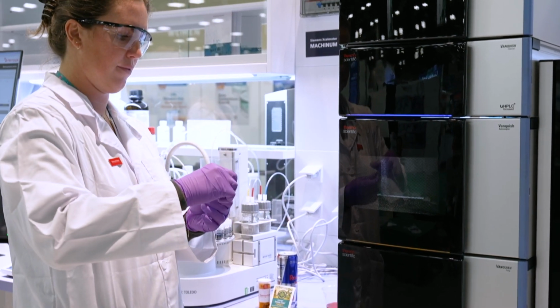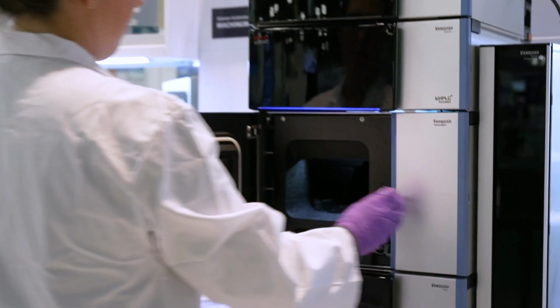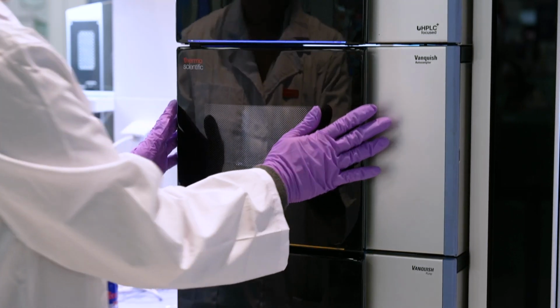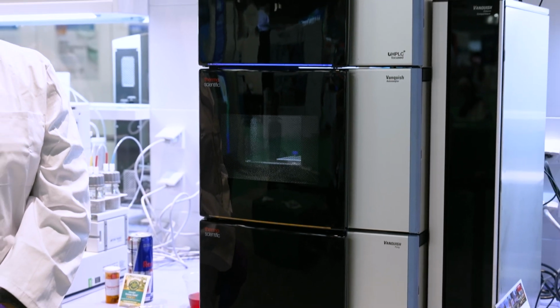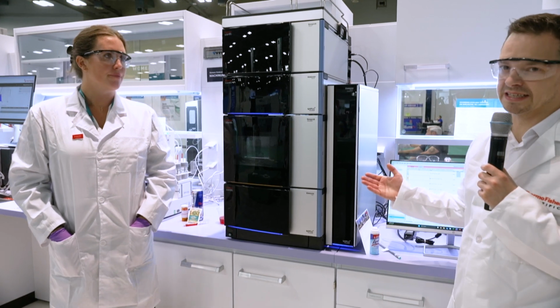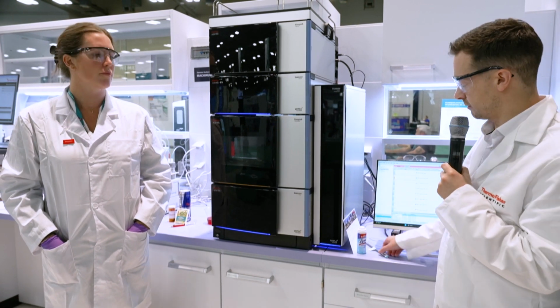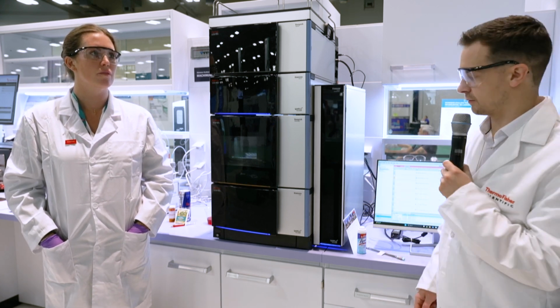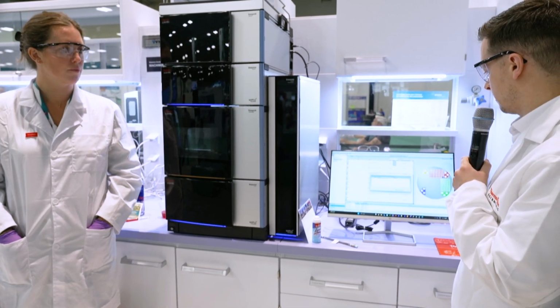One thing I should remind you all of is, when it comes to chromatography and especially charged aerosol detection, because it can detect all non-volatile compounds, it will pick up any contaminants. So you do need to use the best quality consumables. The best way of thinking about it is, if you put quality in, you'll get quality out. That means using high quality vials, high quality columns, and also high quality mobile phases. So if I get the sequence started up.